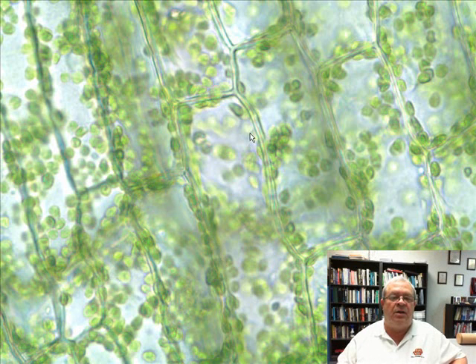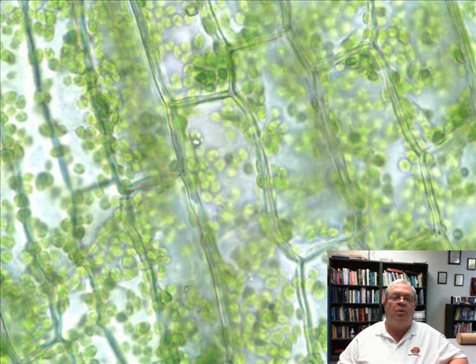And one thing more that we didn't see in onion cells, it's all these round green things. Now what am I tracing here? The cell wall, yes. But inside the cells we have these round green structures. What are they called? Chloroplast. Associated with what process? Photosynthesis. Yeah, we'll talk a little more about that later in the course.